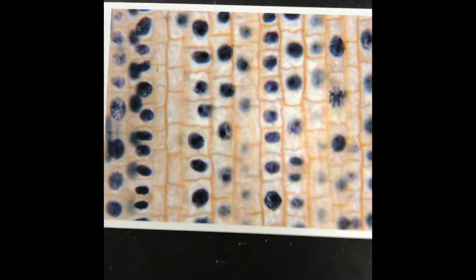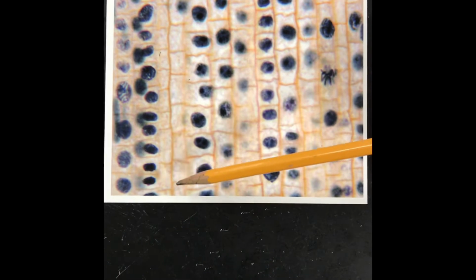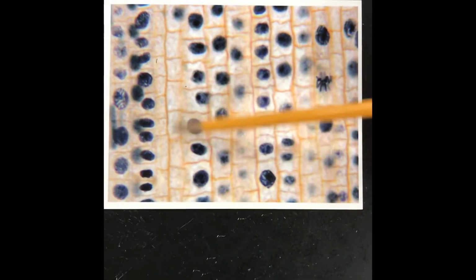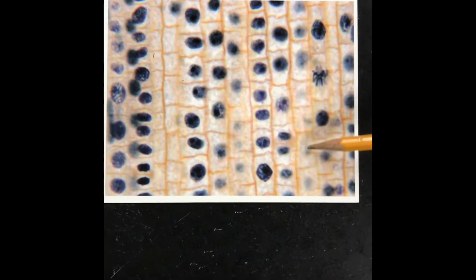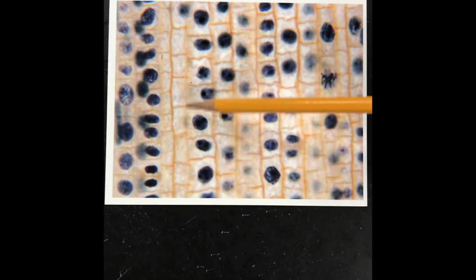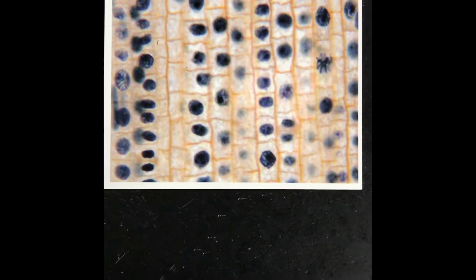Okay, your field of view number 2, I want you to use this image. Now this one has a lot of dead cells. Look at this. Don't count any of these. These are just dead cells. And if it's really hard to tell, I would say this is interphase, even though it's lightened right there, interphase for these, but these are definitely empty, so those are dead. So use this one for your field of view number 2, and then use this one for your field of view number 3.